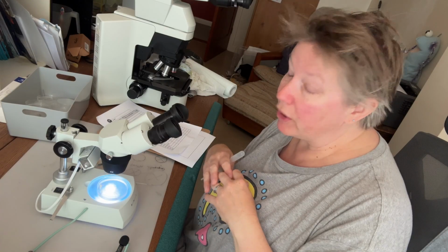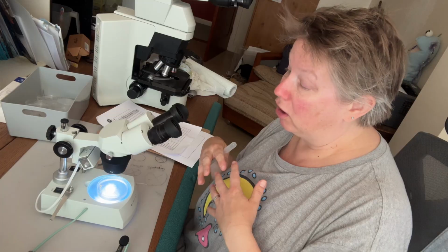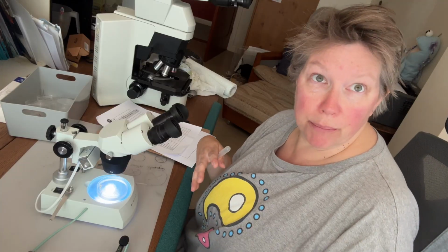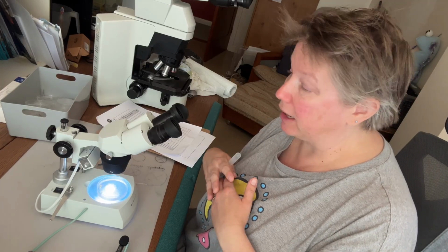larvae. When you're looking at your sample for the first time, make a note of the things that stand out to you. Is there a lot of one particular organism, for example? Is there a lot of that organism compared to maybe previous weeks? Is there something in there unusual that you don't see very often? Perhaps you can make notes of that as well.